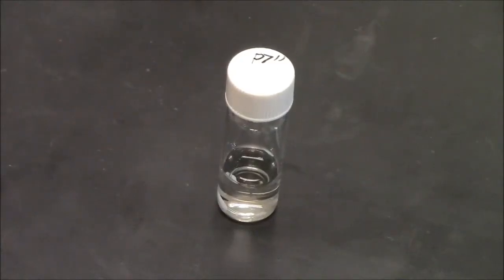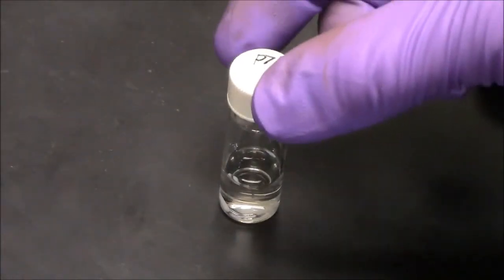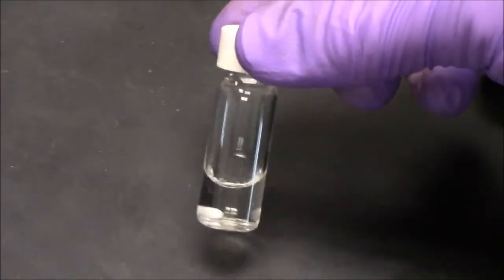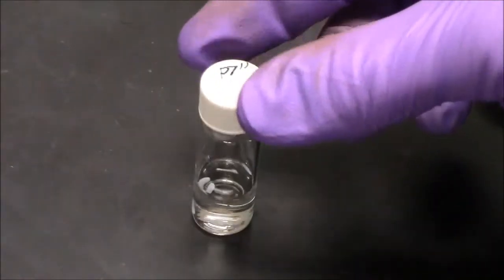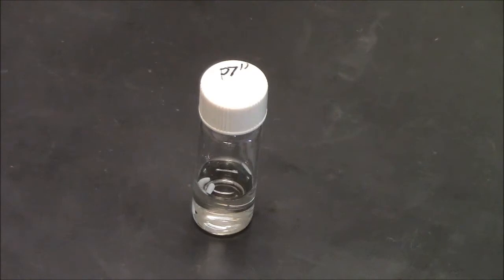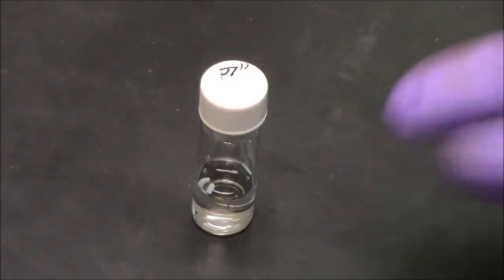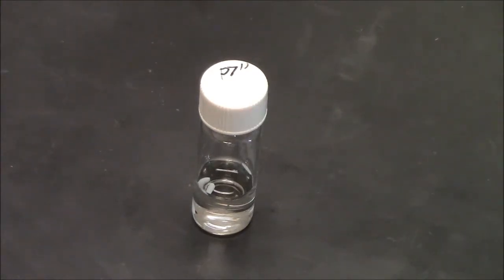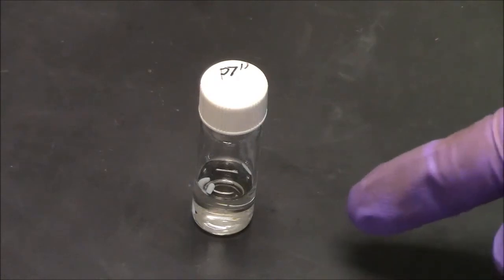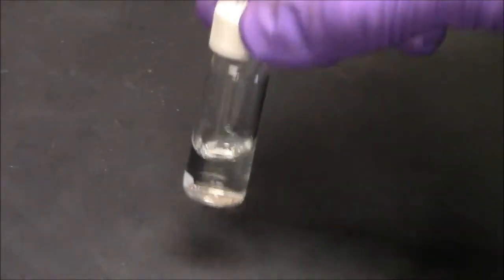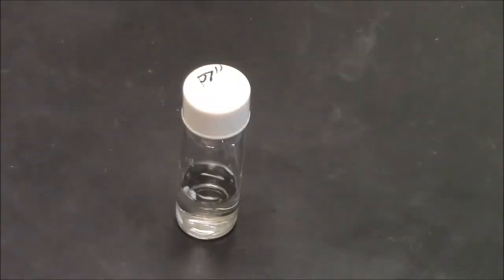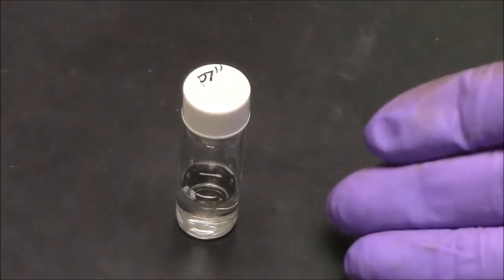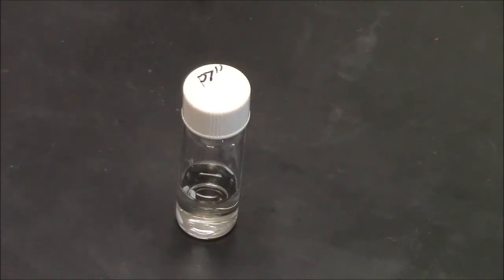Here is a polymer, non-imprinted, that is largely made of nipam, N-isopropyl acrylamide. You can see it looks like water. There is no evident polymerization. But this type of polymer has a phase transition temperature of maybe about 35 degrees Celsius, and it is possible we do have polymers here that are invisible to the eye.